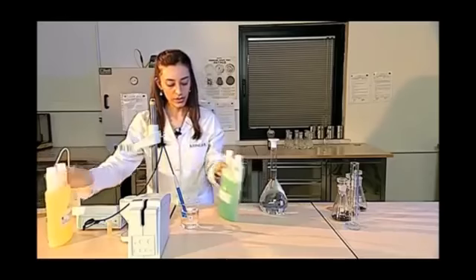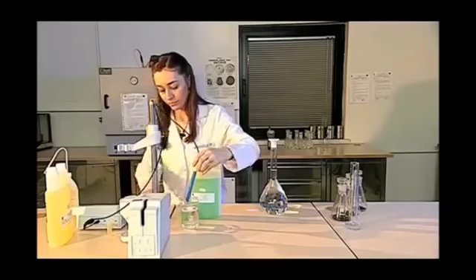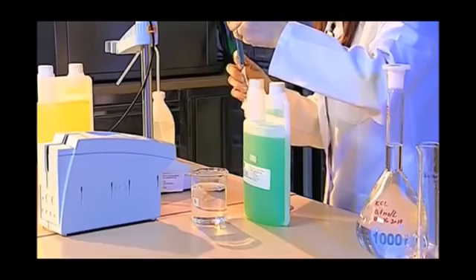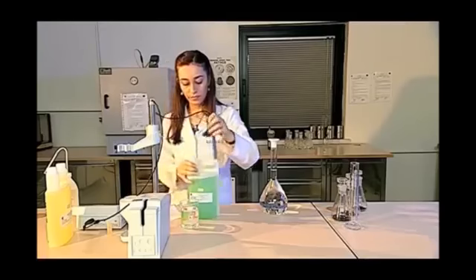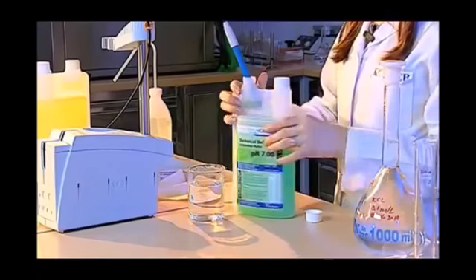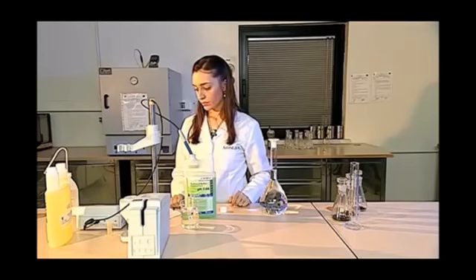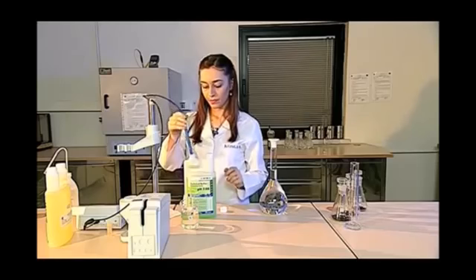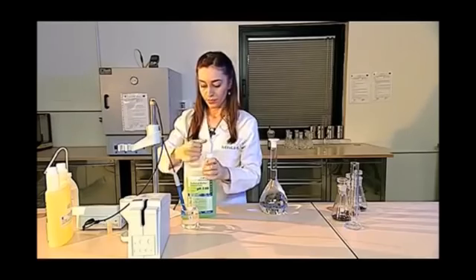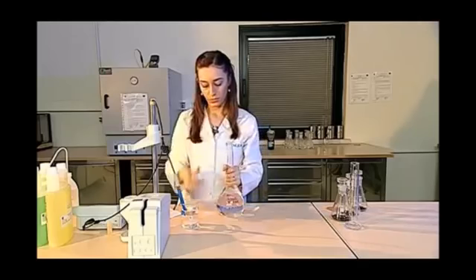In the final stage of the pH 7 calibration, I go back and measure the pH of it, and the calibration of the pH is completed. The tip of the pH meter, namely the tip of the electrode, is a very sensitive piece of apparatus and should never be exposed to shocks, and its tip should be cleaned properly every time. In the same way, I look at the correspondence of the pH with its observed temperature, and if I observe that it is suitable, I say there is no problem. I observe the value on the screen, and I complete the calibration of the pH meter. When the test is not in progress, that is, when the pH meter is off, the electrode tip of the pH meter is kept in the potassium chloride solution.